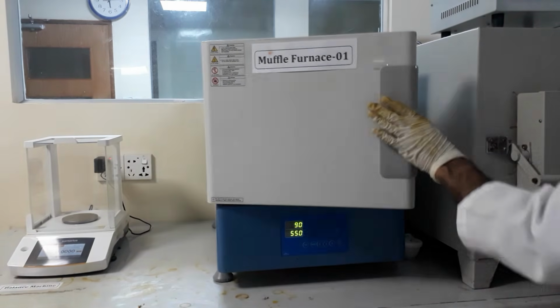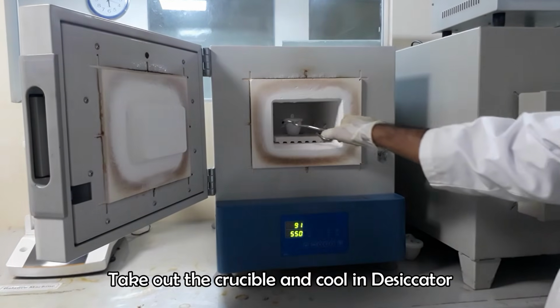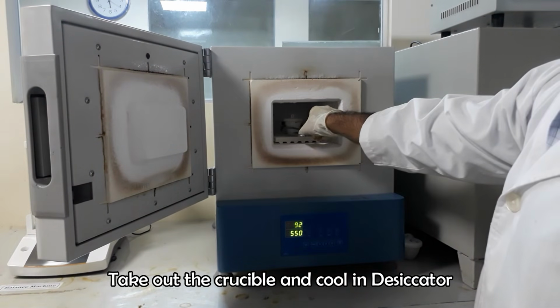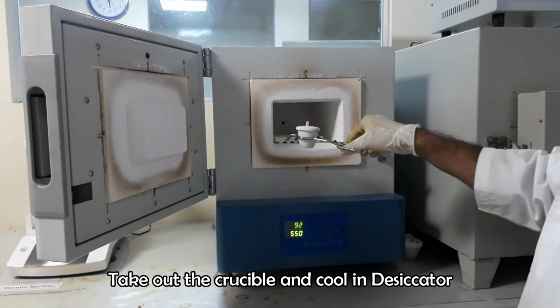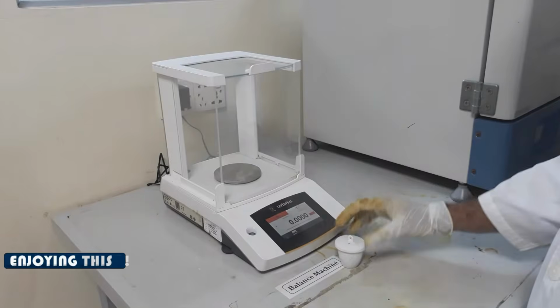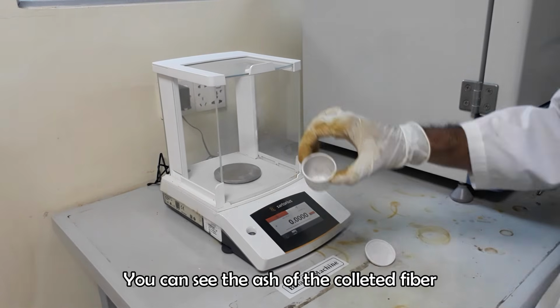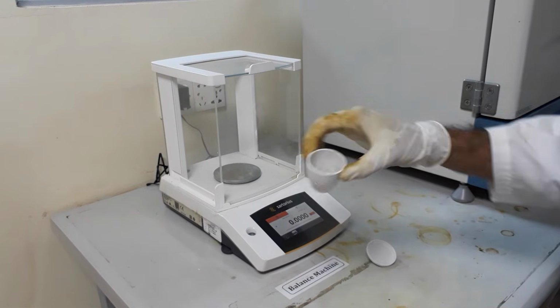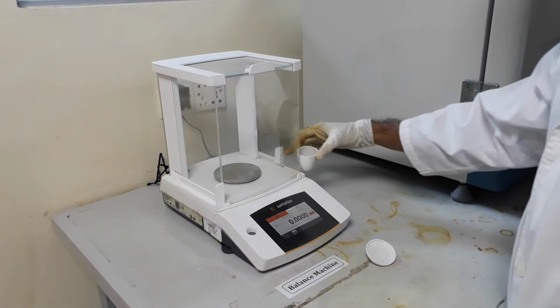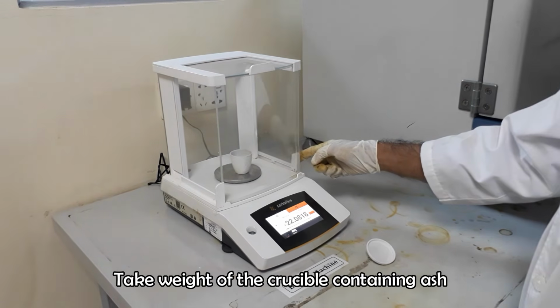After burning, take out the crucible from the furnace and cool it in desiccator. Take weight of the crucible with ash.